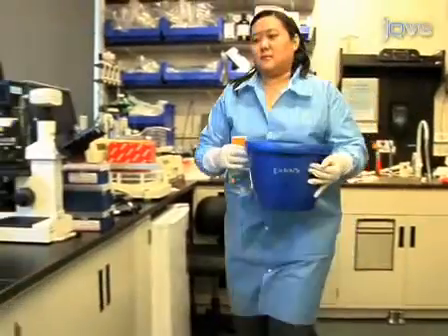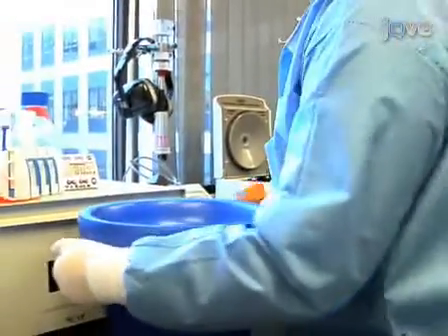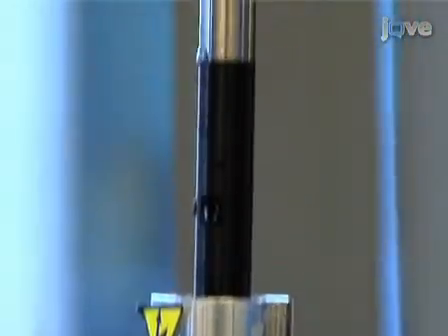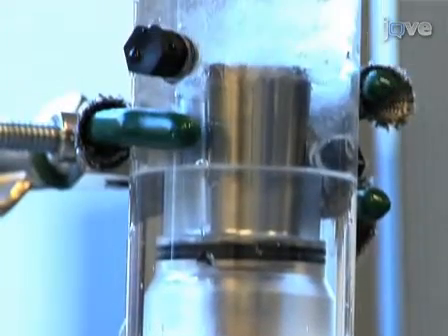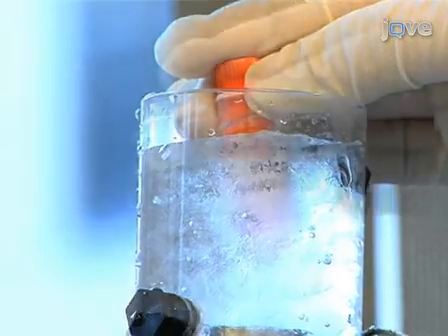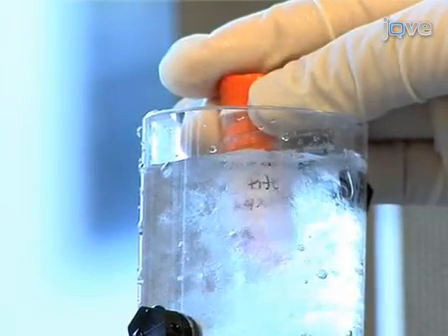We've just shown you how to perform a time course infection with the Vaccinia virus and how to extract the RNA from infected cells at various time points post-infection. When doing this procedure, it's important to remember that there are several critical steps in setting up a synchronous Vaccinia infection. First, careful sonication or trypsinization of the virus is important to disaggregate virus particles, since Vaccinia is highly prone to aggregating, which would prevent an even infection of cells.